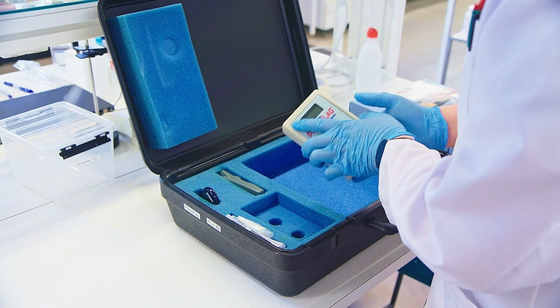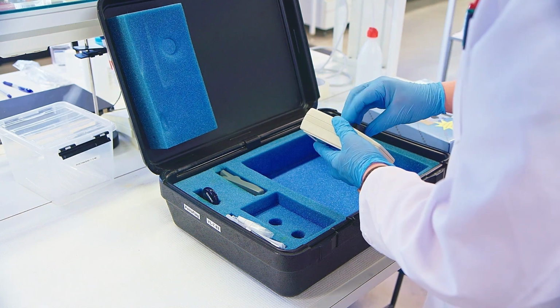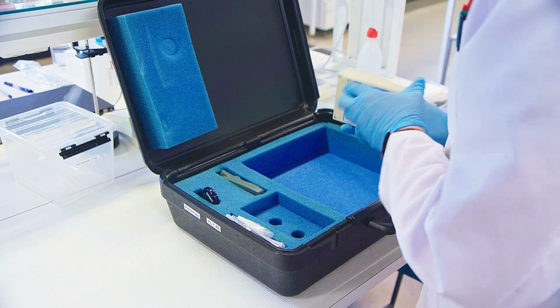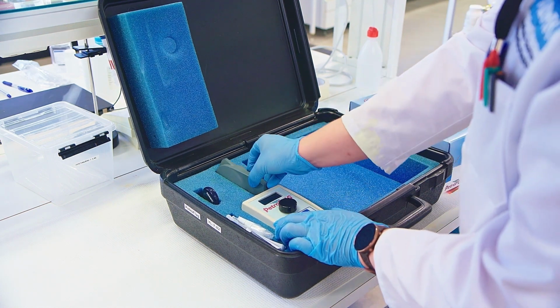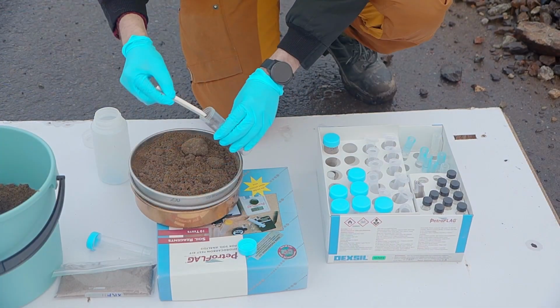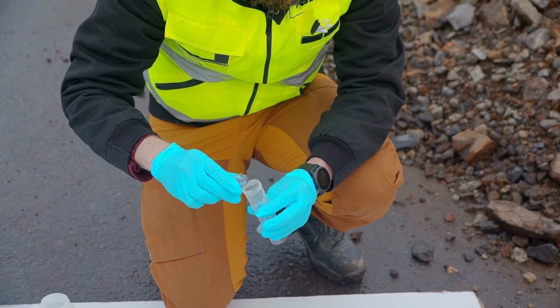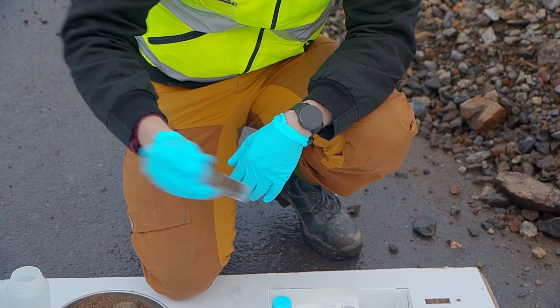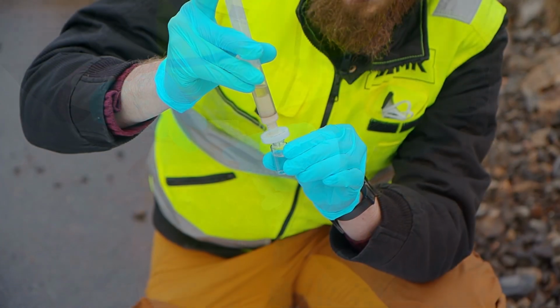Petroflag is a turbidimetric field analyzer for inspecting the total petroleum hydrocarbons in soil samples. The method can be used, for example, in the survey and remediation projects of contaminated areas, oil spill response, and the disposal facilities for oil-damaged soil. Petroleum hydrocarbons are extracted from a 10-gram soil sample with a methanol-based solvent, after which the liquid is filtered into a developer fluid. The hydrocarbons contained in the sample cause a chemical reaction that causes the solution to become turbid, and this turbidity can be measured.